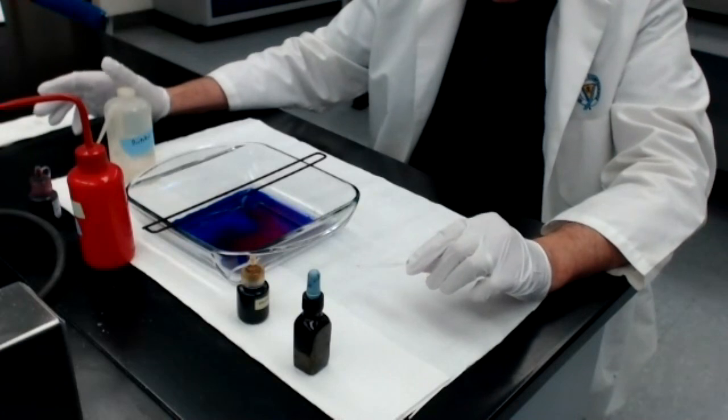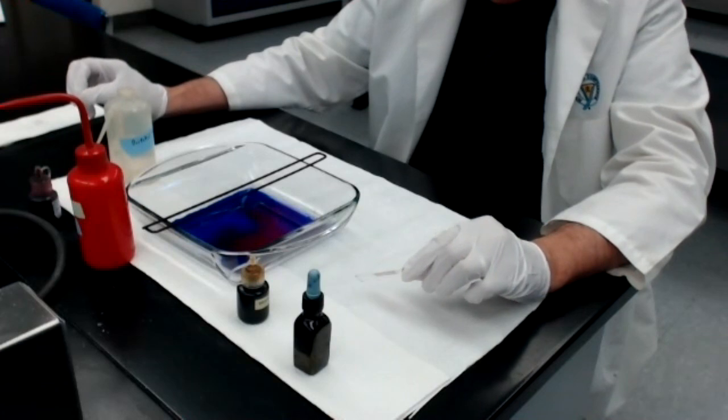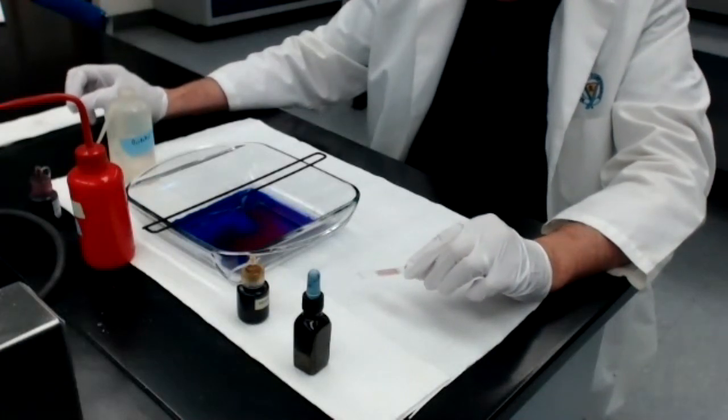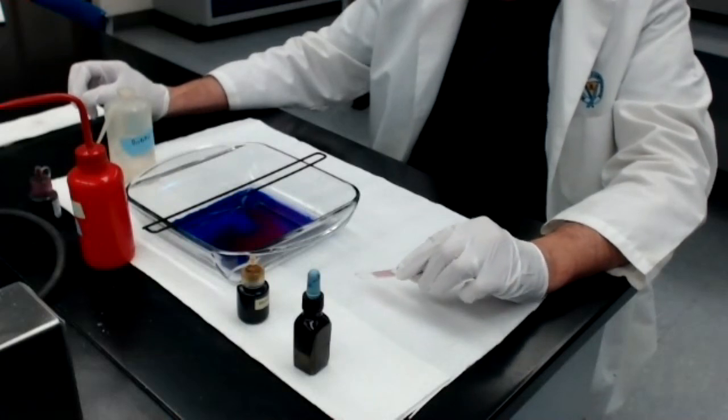Of course, I'll know I'm looking at Staph aureus because Staph aureus will appear as very tiny spheres, and I'll know which ones are E. coli because E. coli will appear as tiny rods. So hopefully the spheres will be purple, blue, black, and the rods, which are E. coli, will be pink or red.